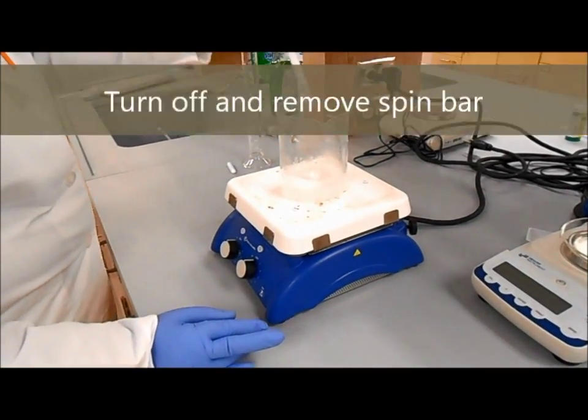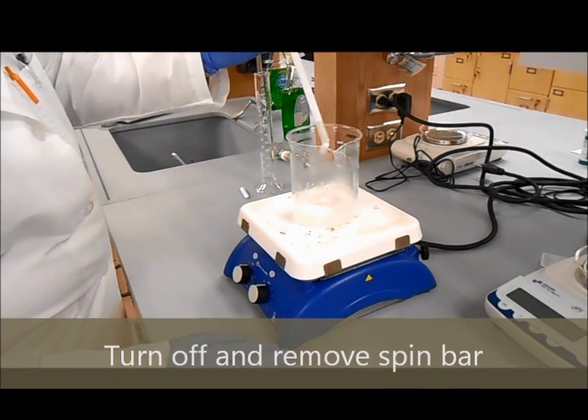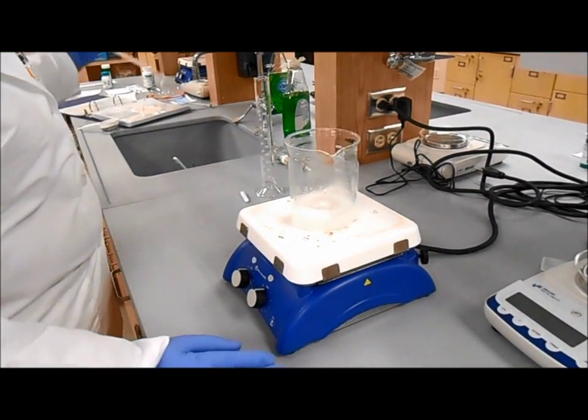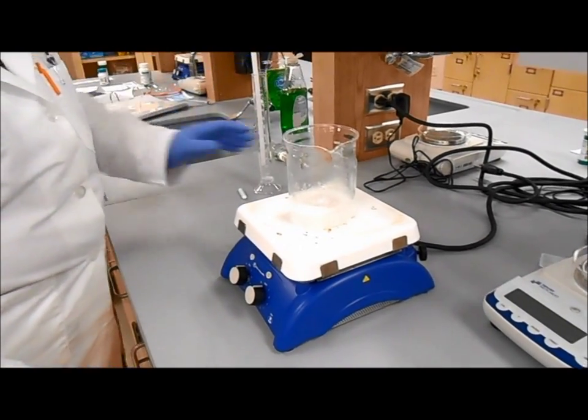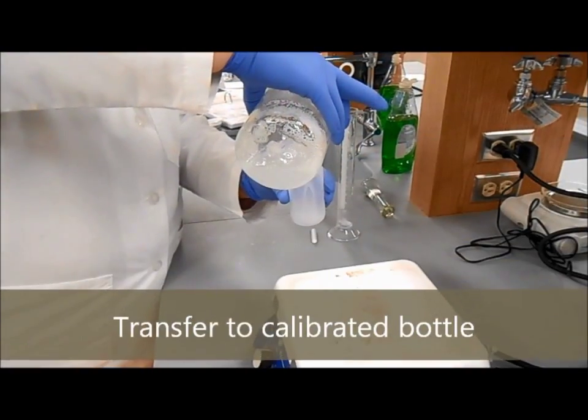After a minute, turn off the stirring, remove the spin bar, and then transfer to the bottle.